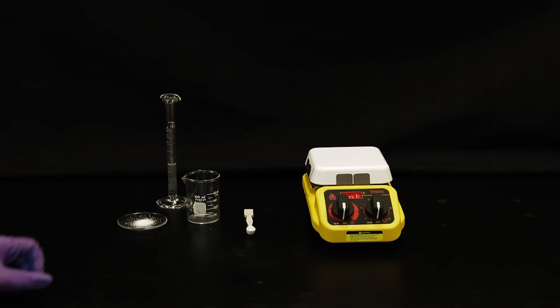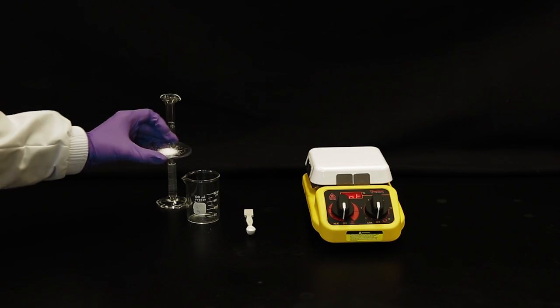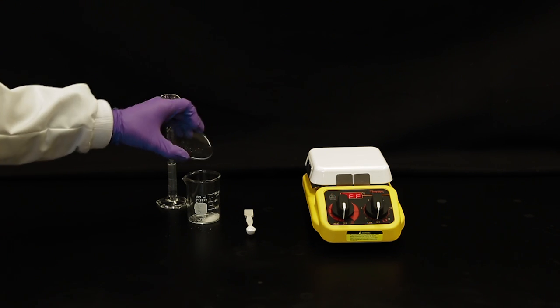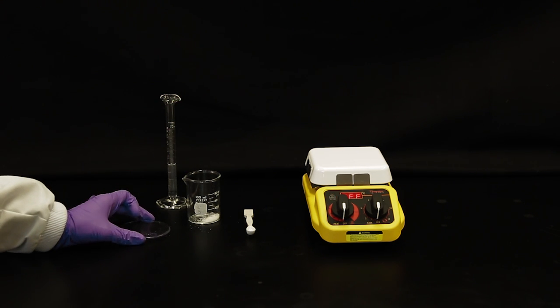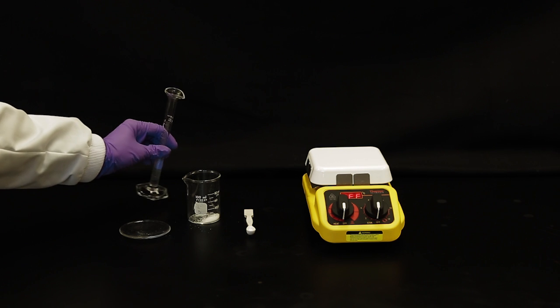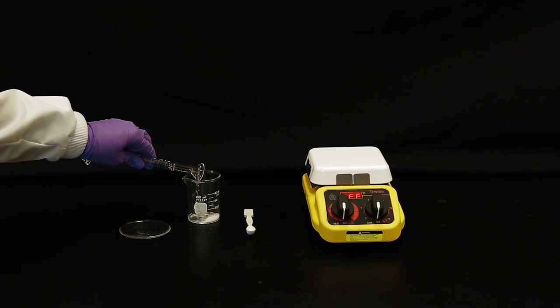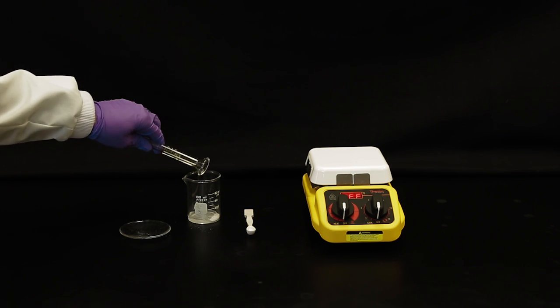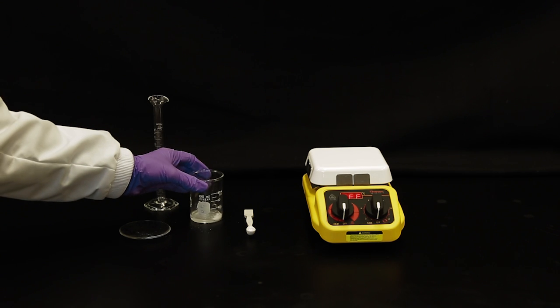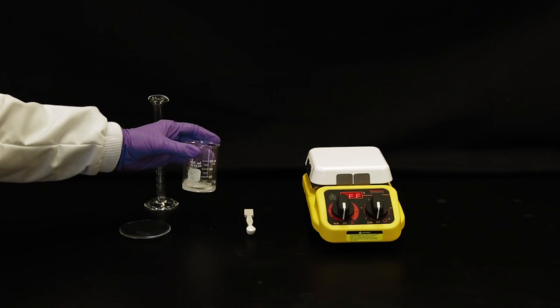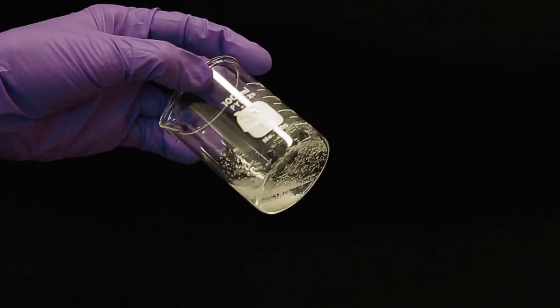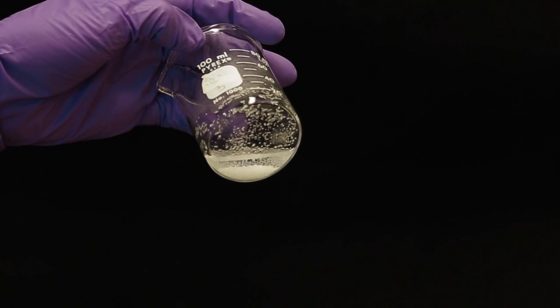Place your crude material into a beaker. Add a small amount of water at room temperature and swirl. Notice that very little of it dissolves.